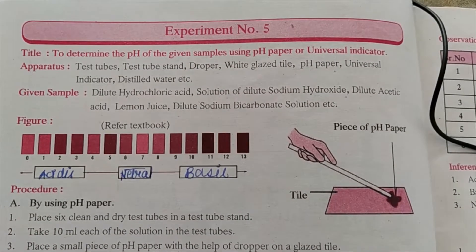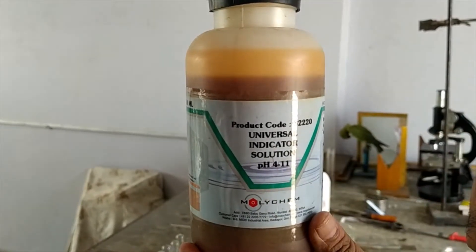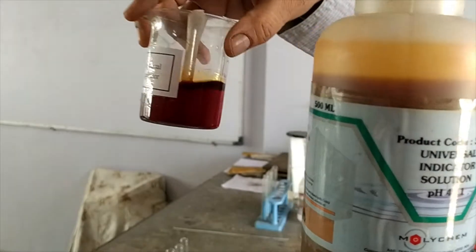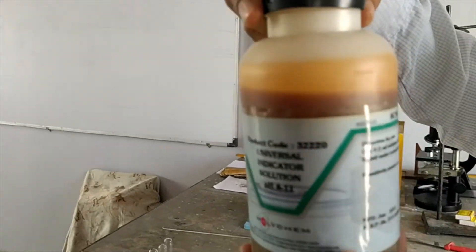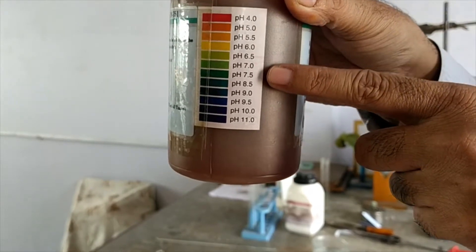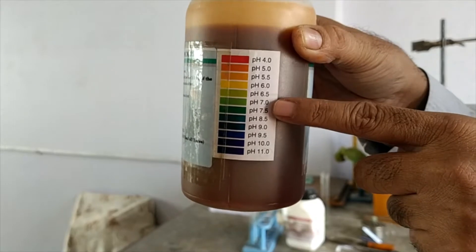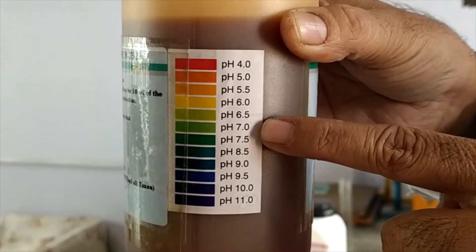I will show you first what is universal indicator. This is universal indicator. This solution is reddish in color. On the same bottle you will see the different colors of the solution, along with the pH written over here. The pH 7 which is greenish in color means this is the neutral solution.